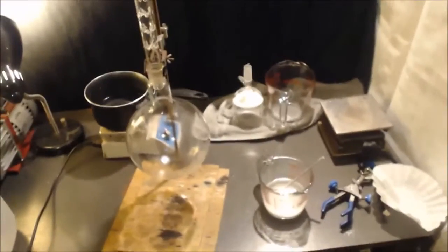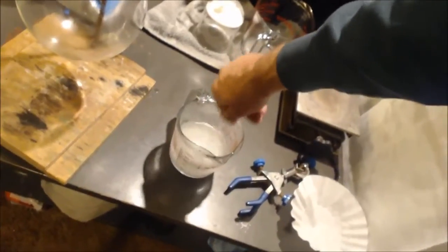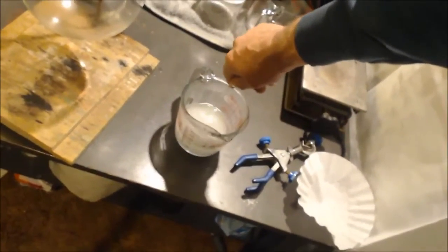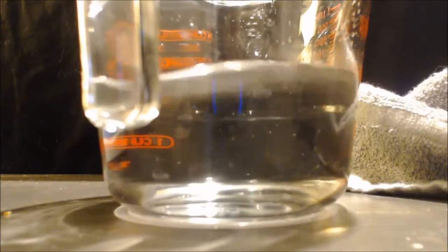My apparatus: down at the bottom I have a round bottom flask, and it goes up with a Vigreux column. And on top I'll put a filter. Now, I boiled the water that had the damp rid in it. I boiled all the carbon dioxide out. I don't know how good it'll be. I heated everything up. Okay, I'm going to add the sodium hydroxide to the damp rid solution.